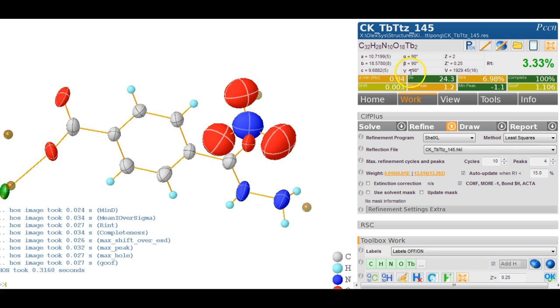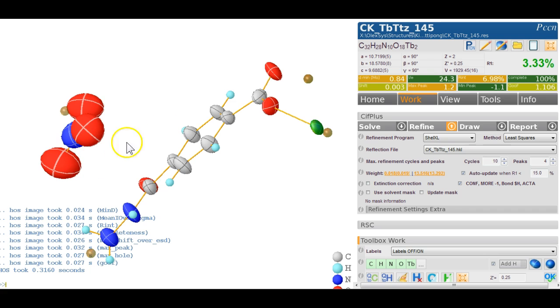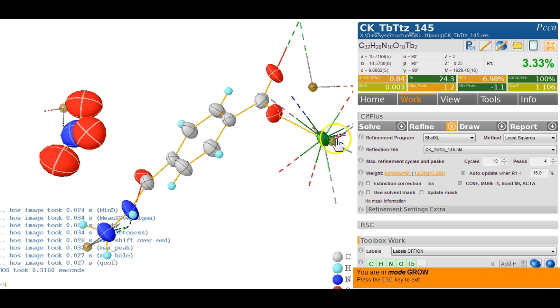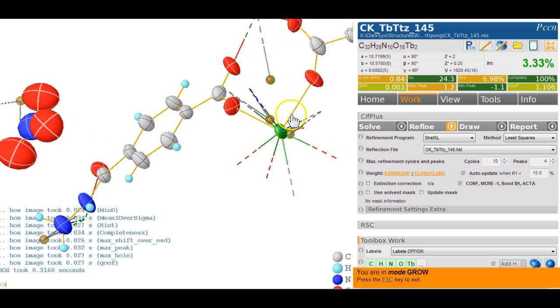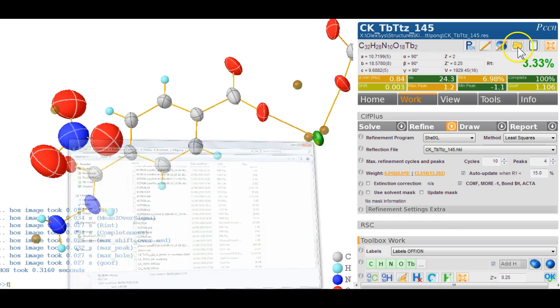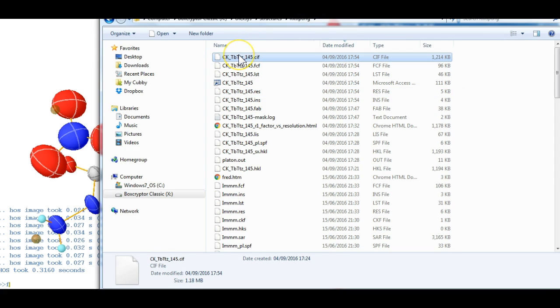Now, what we need to consider is what we want for our Z prime. It's currently 0.25, and I think this makes sense. Control grow. Well, maybe it doesn't make sense. That is a matter of taste now, to decide what your unit here should be, but at the moment we have a unit based on Tb2, and just to make sure that the CIF file is correct, I can click on this date modified. This should be that CIF.